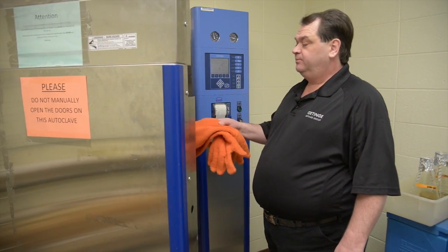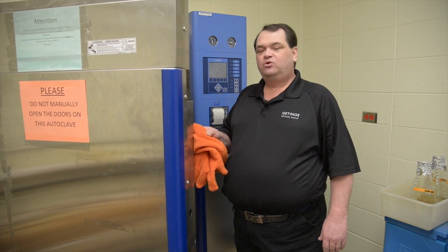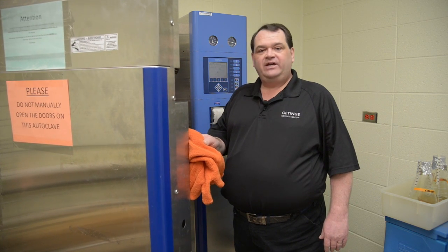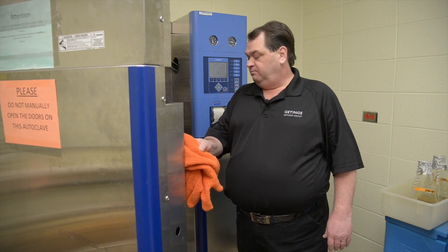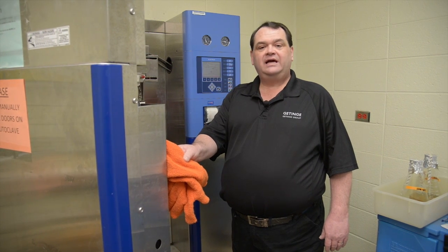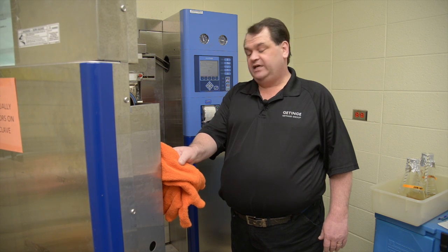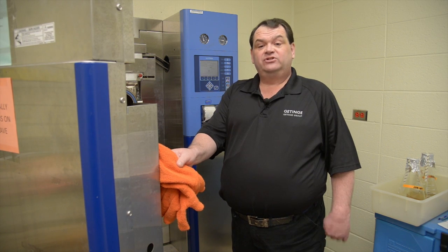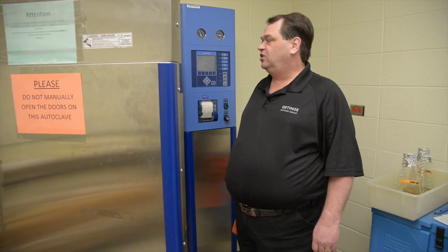It's very important to not be in the way of the door as it swings closed. If something is obstructing the door there is a safety mechanism that allows the door to disengage its clutch — much like an elevator door, once it senses pressure it will stop its motion. Once the door has pivoted around, the clutch will re-engage; that's the pop noise you'll hear. At that time, if there are no obstructions, you can release the door and it will go back to its closing action.